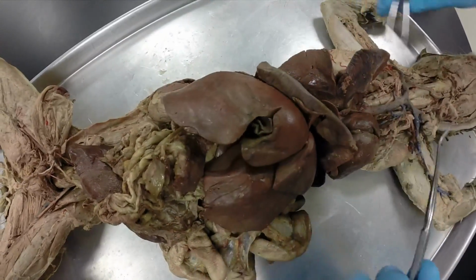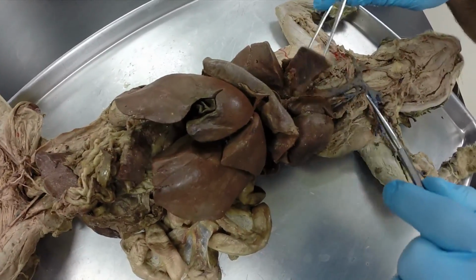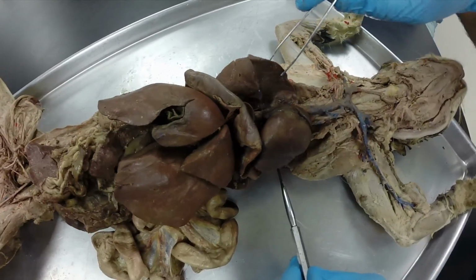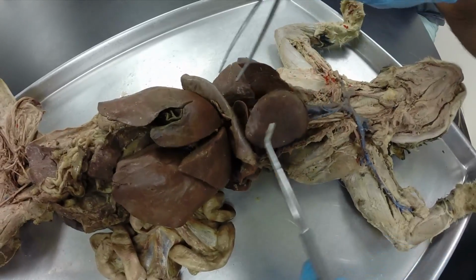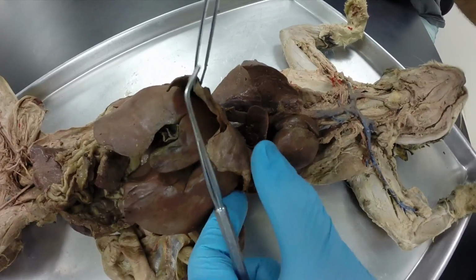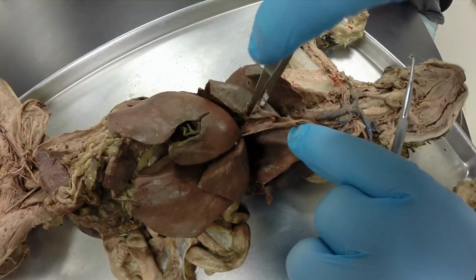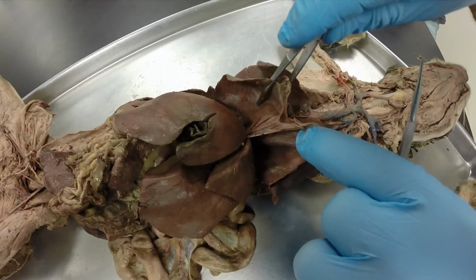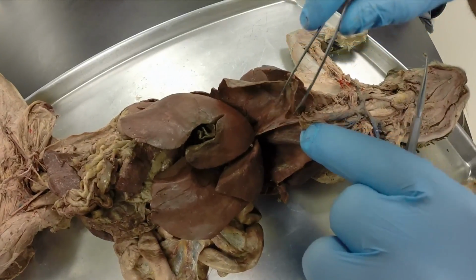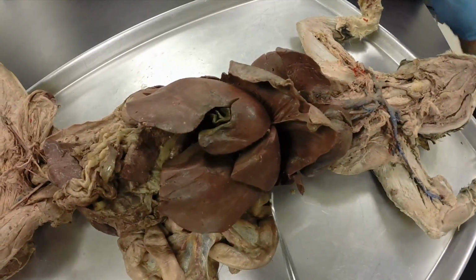Okay, if we go back a little ways, this is our heart, this is lungs. Now I've removed the upper two lobes on left and right to see these veins a little bit better, but this is all lung. This muscle right here is the diaphragm, and we have this little piece of connective tissue right here. This is called the falciform ligament. Falciform ligament? Yep. And it's basically between the diaphragm and the liver right here.